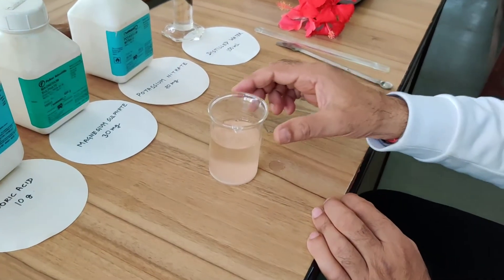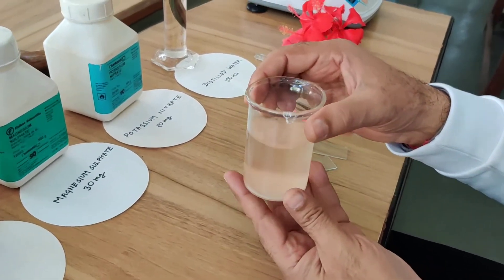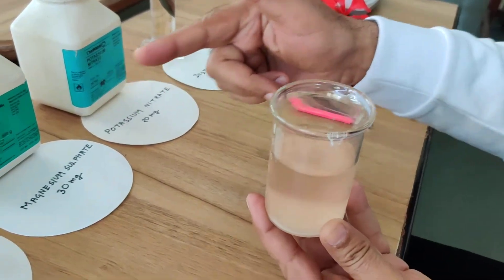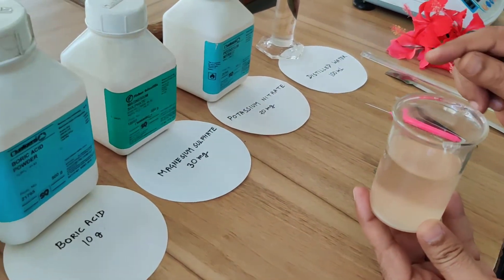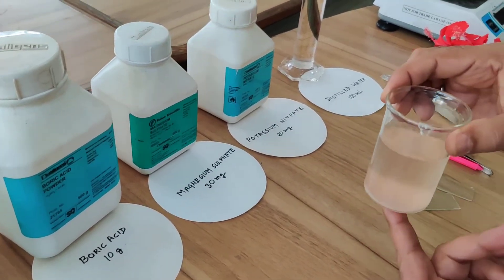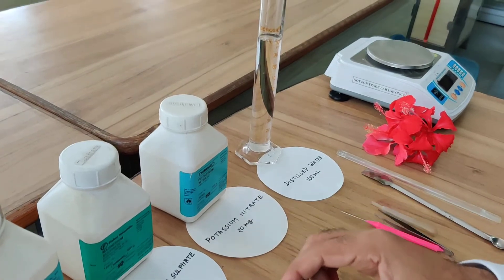I have already prepared this nutrient solution by mixing all these chemicals in their specific quantity in 100 ml of distilled water.